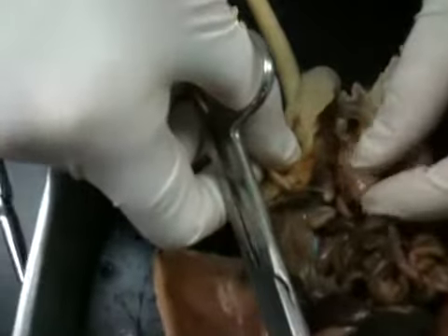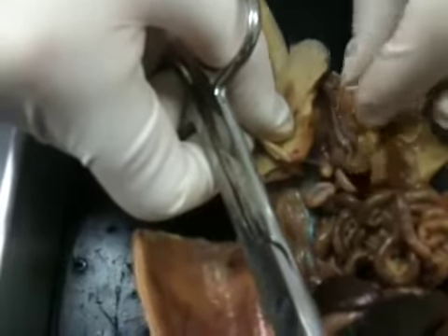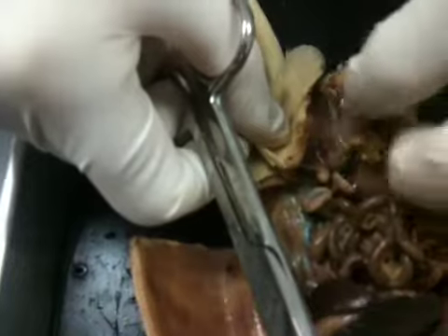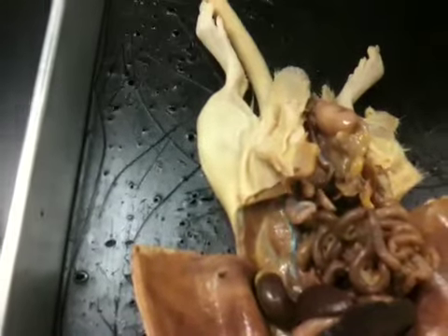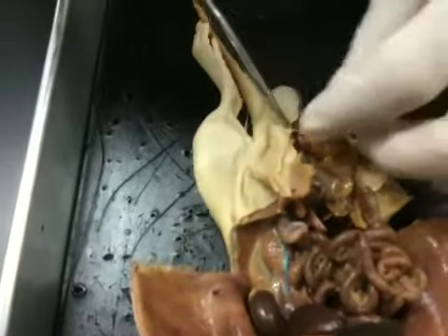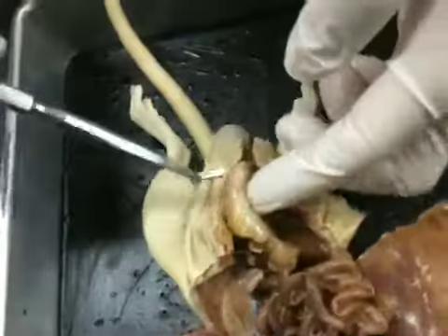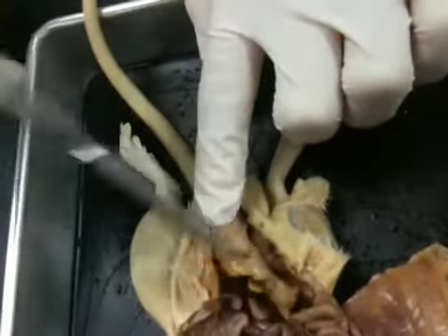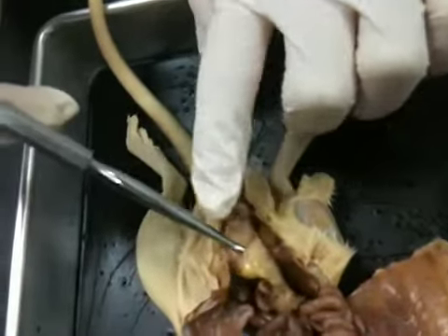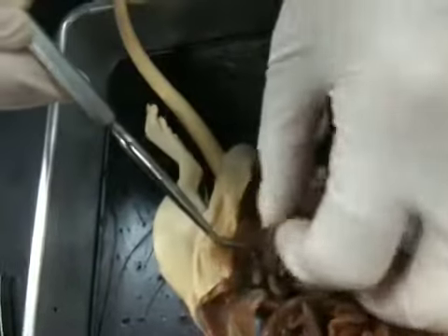And you can see this testes is actually up here when it should be down here. So that's what they would actually do in a human, right? They would actually release that tendon and allow it to come down here. So this is the testes. The epididymis forms up underneath and comes all the way up here, and you can see a large portion of the epididymis right here. Okay, so this is the epididymis right there.